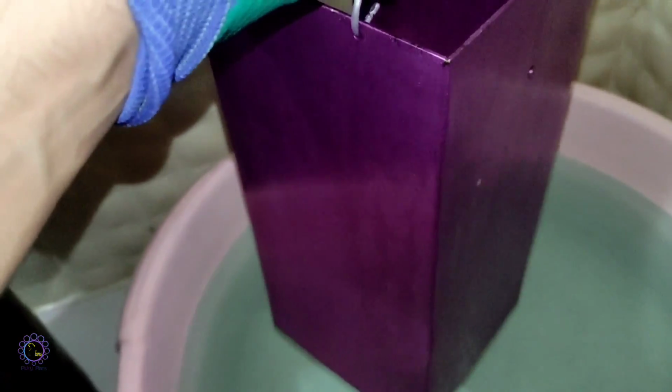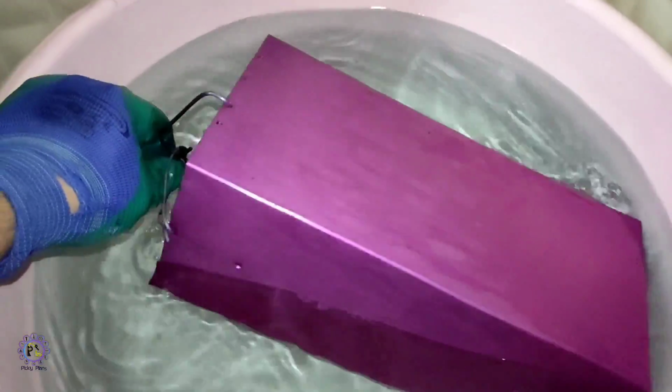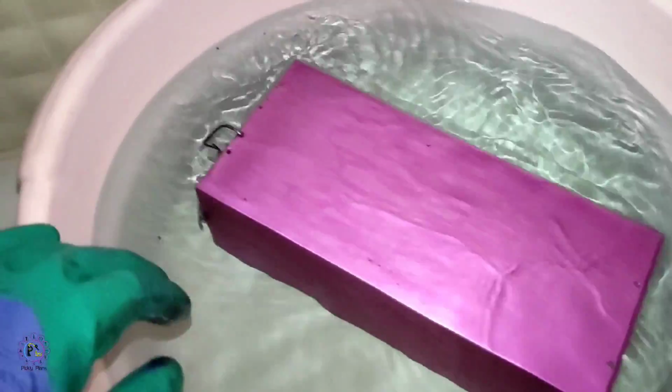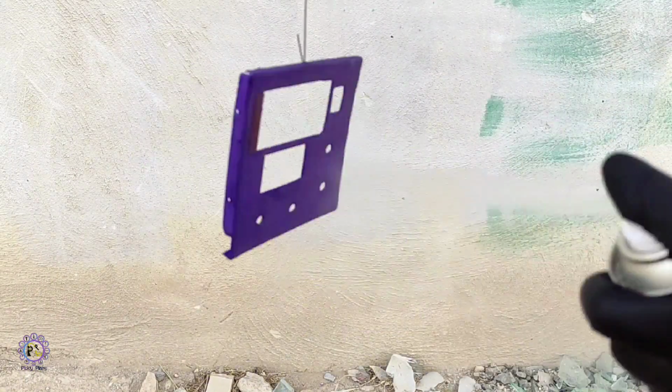Next the colored part was added to the nickel salt bath to become sealed completely. Normally I shouldn't be painting over the anodized aluminum, but I decided to cover part with polyester based coatings to insulate the casing and also protect the color.